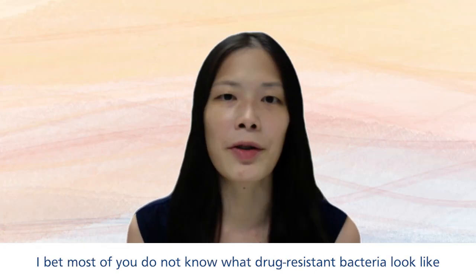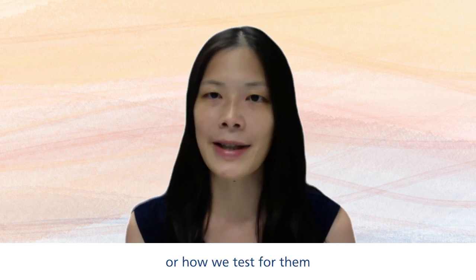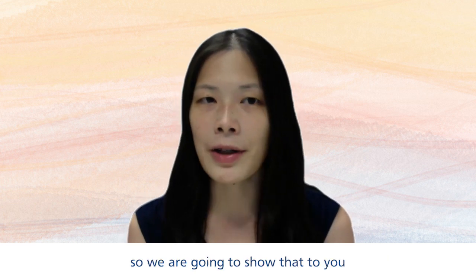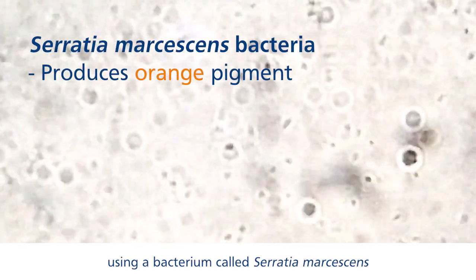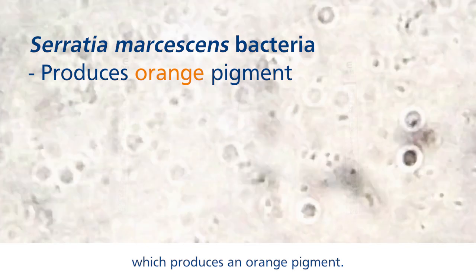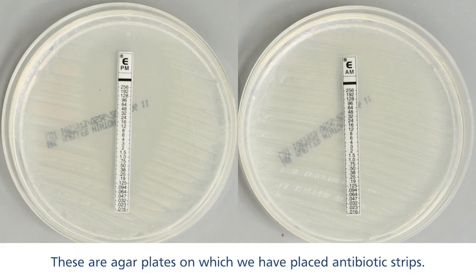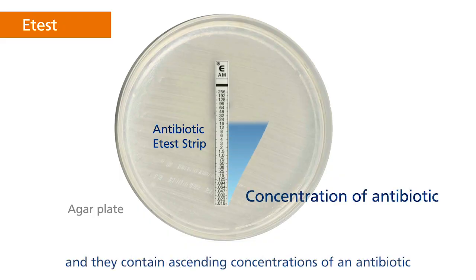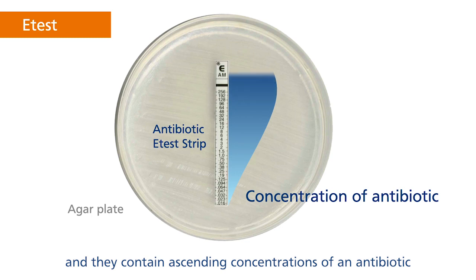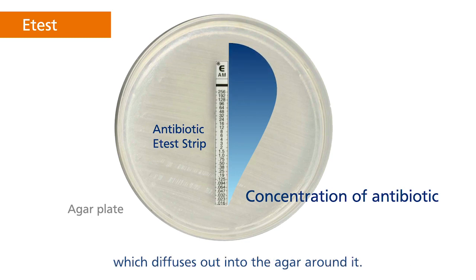I bet most of you do not know what drug-resistant bacteria look like or how we test for them. So we are going to show that to you using a bacterium that produces an orange pigment. These are agar plates on which we have placed antibiotic strips, called E-test strips, which contain ascending concentrations of an antibiotic that diffuses out into the agar around it.